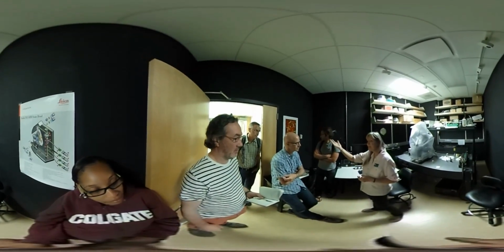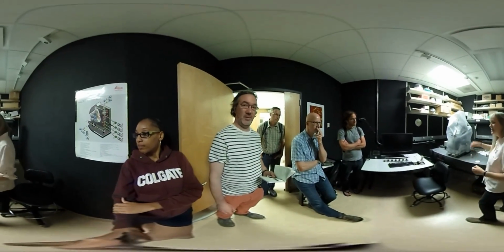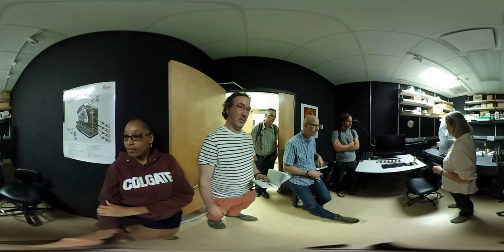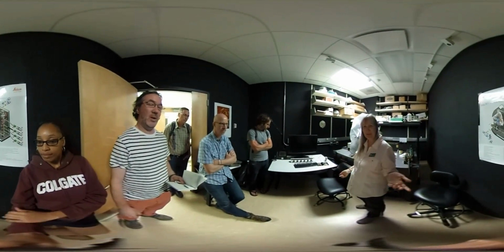And live materials can be put under this microscope. We can fire up the lasers, hit those dye molecules, and they cause the emission of different wavelength light. And that light can be collected and digitized and put on a computer, and you can generate these wonderful images.